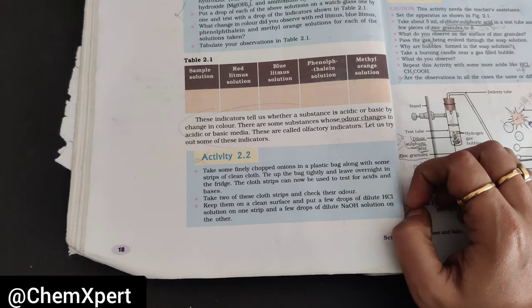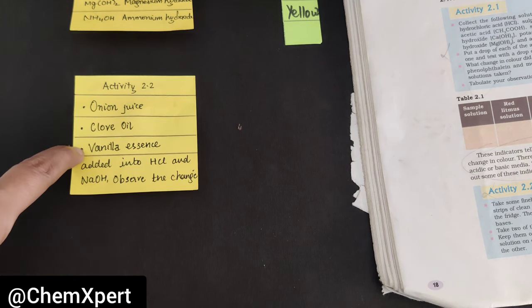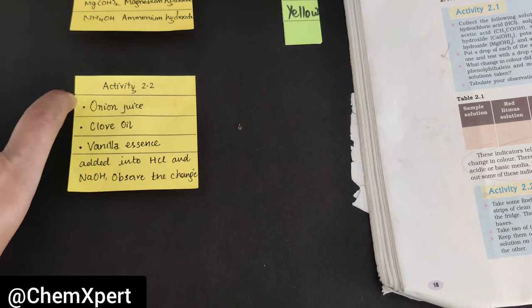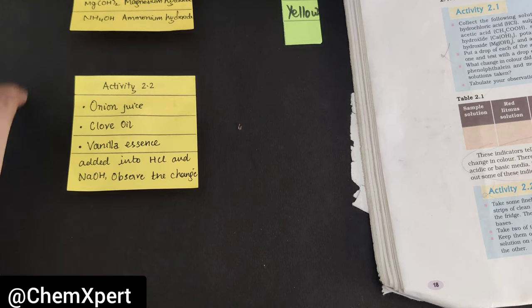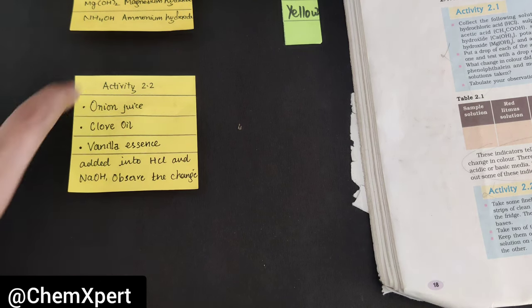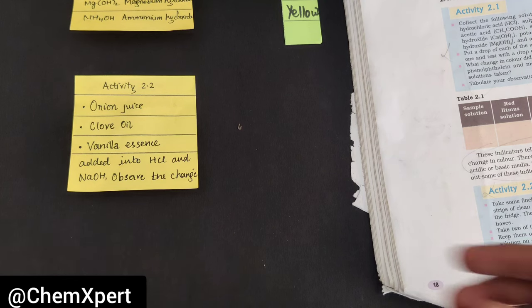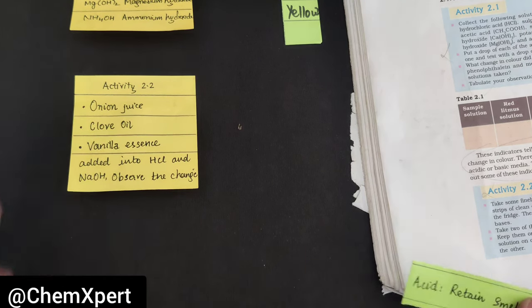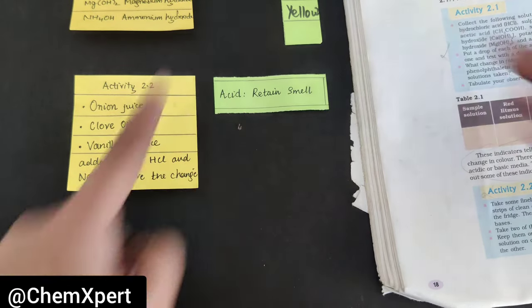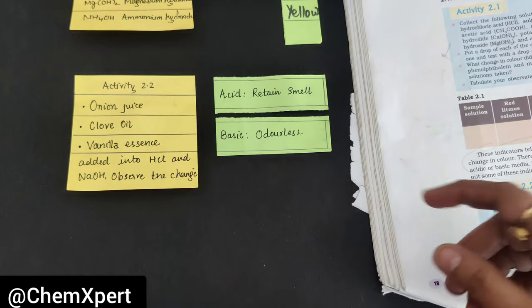Activity 2.2 is based on olfactory indicators — those that give a different smell in acid or base. The samples taken are onion juice, clove oil, and vanilla essence. For each sample, cloth is dipped in the solution overnight. Next day the cloth has a particular odor. In case of acid, the cloth retains its smell, whereas in case of base, the odor is completely destroyed and it becomes odorless.